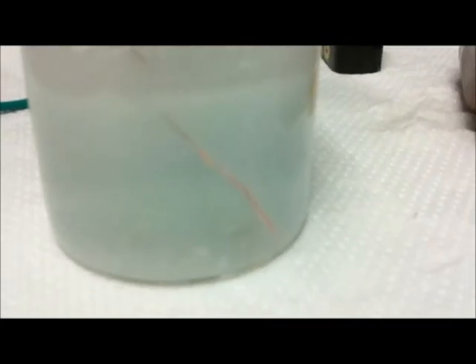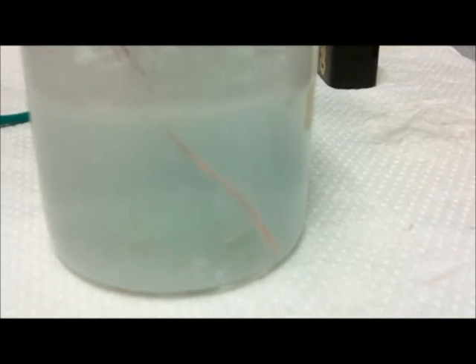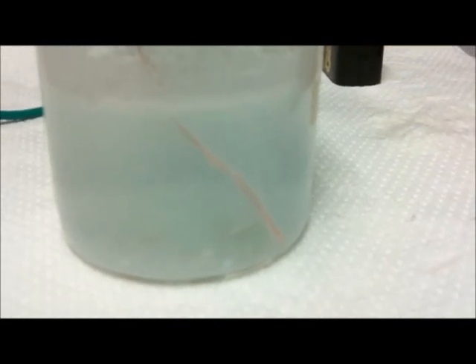We can see that one of the wires is bubbling with hydrogen gas. Since hydrogen gas is being evolved, this reaction should be done in a well-ventilated area.